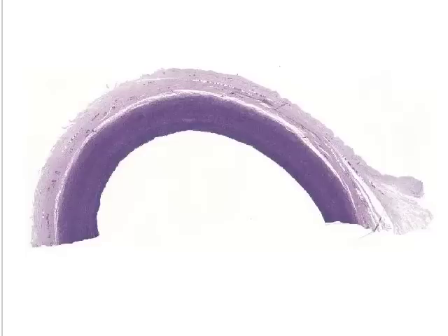Okay, let's revisit the various parts of the vascular system, and in particular we're going to start off by looking at the aorta, which is something that you've looked at before. And in the image that we see here, this is an aorta that, as you've seen before, has been stained with a special stain to demonstrate elastic fibers and elastic lamellae.